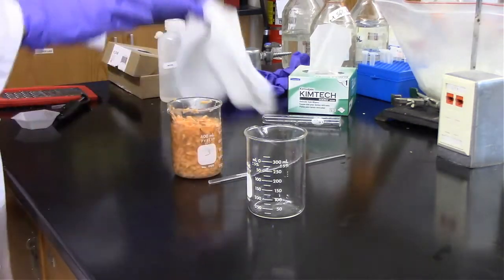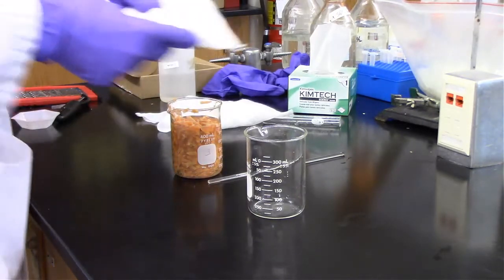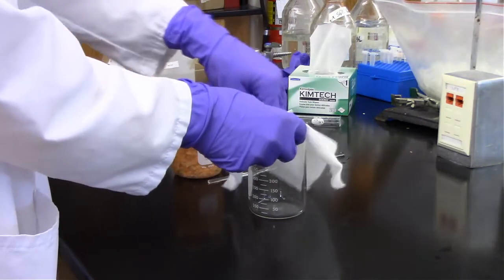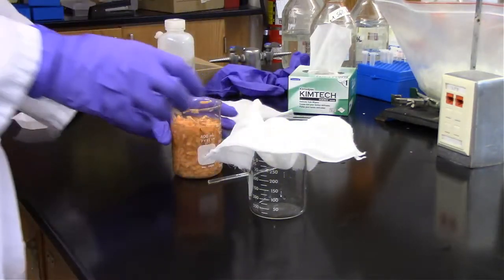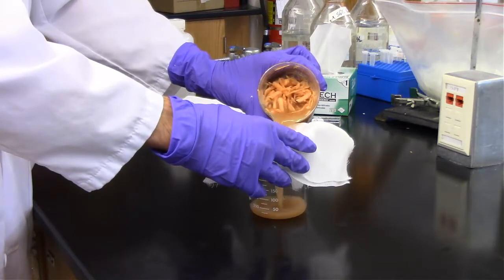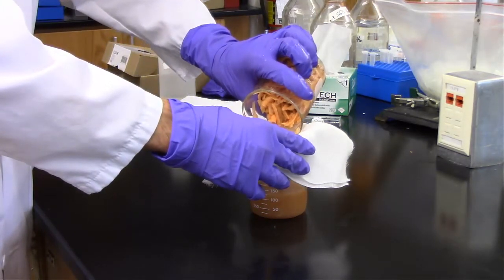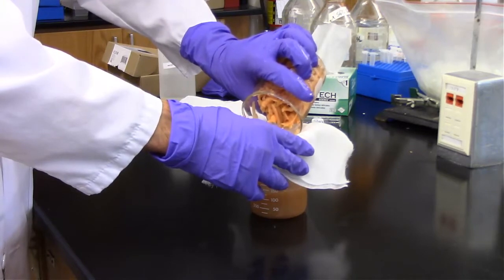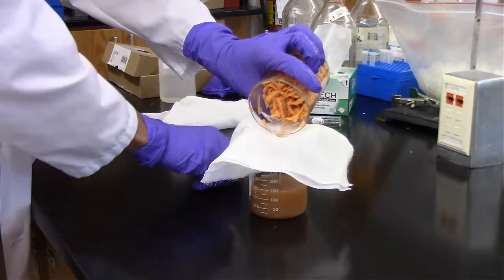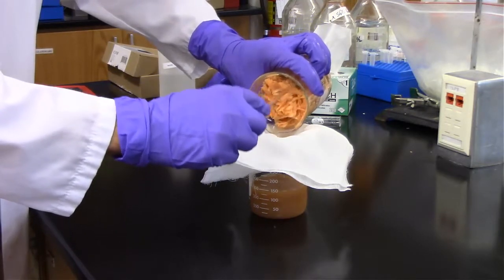Starch, normally you think sugar is soluble in water, but starch actually is not all that soluble in water. It's actually a long chain polymer, which means it is not going to be soluble in water. However, once we can dissociate it from the fiber of the potato, it will run through that cheesecloth filter. That cheesecloth filter has some pretty large areas that polymers can actually run through.